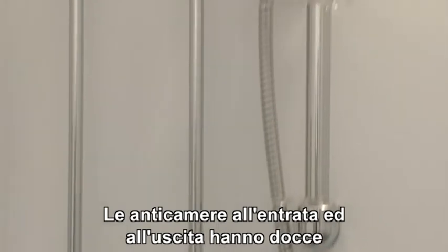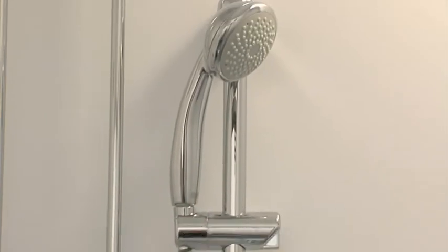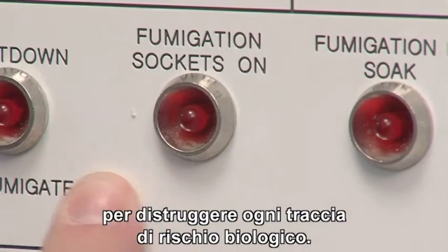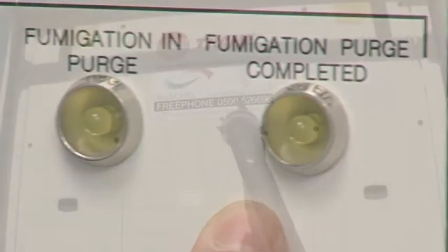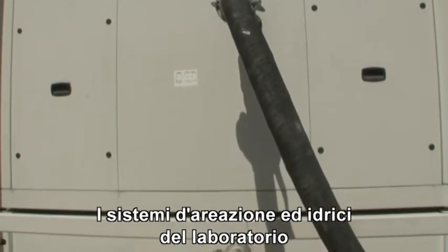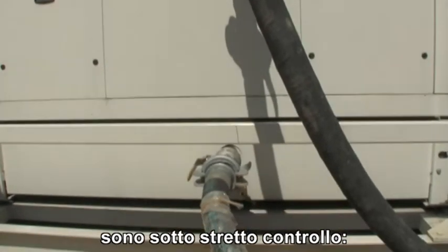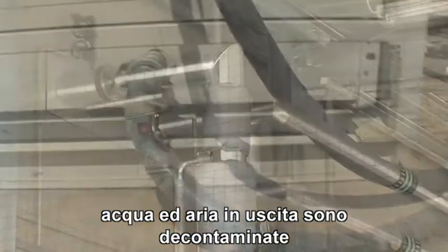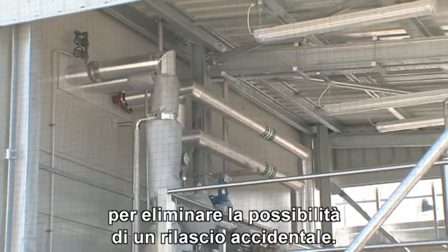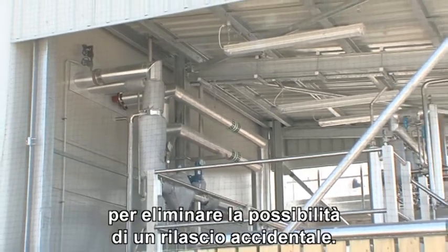The entry and exit antechambers provide showers and other safety precautions designed to destroy all traces of any biohazard. The air and water systems going into and out of the lab are strictly controlled. Outgoing water and air undergo decontamination procedures to eliminate any possibility of an accidental release.